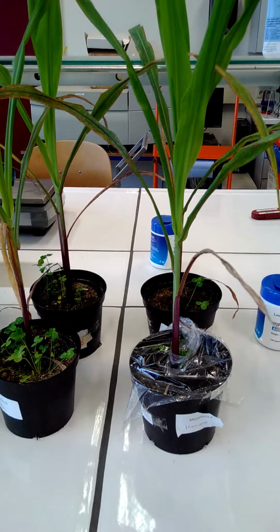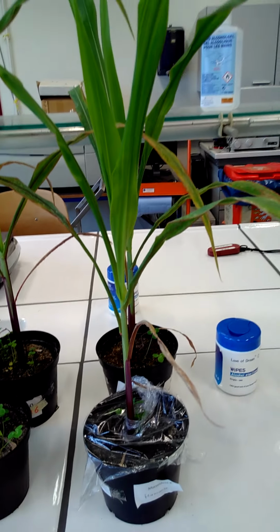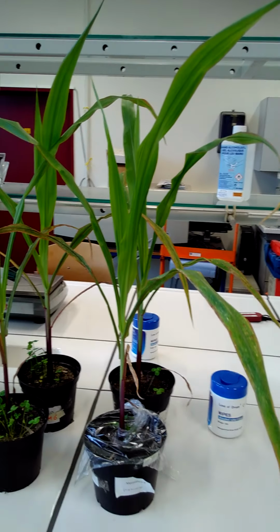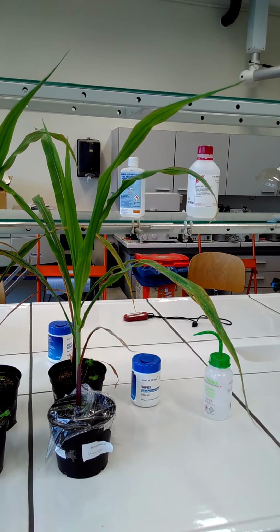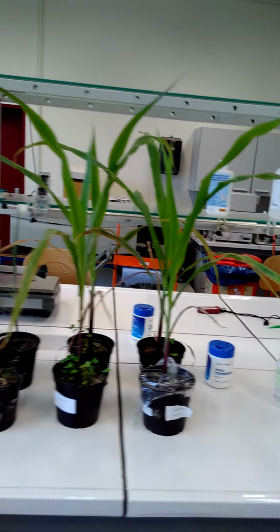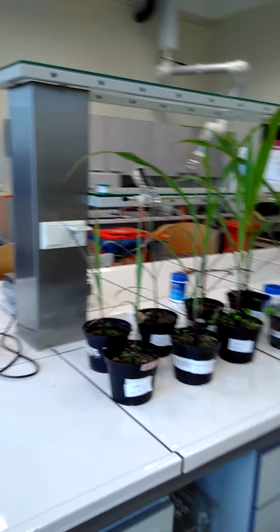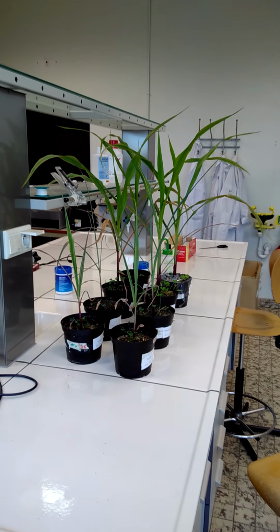And so plants, of course, they need water, and they lose it through their stomata, so that's pores, which you can mainly find in the leaves. And that's what we're going to determine today. Now, we will compare that between the treatments, but we'll do that in 2 ways. And the first way will be very easy.